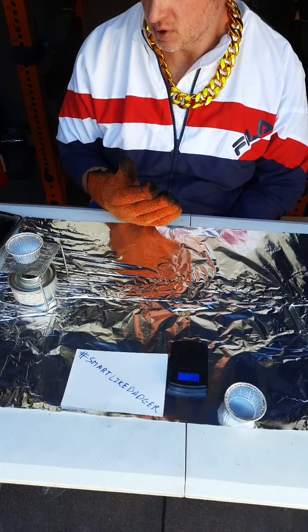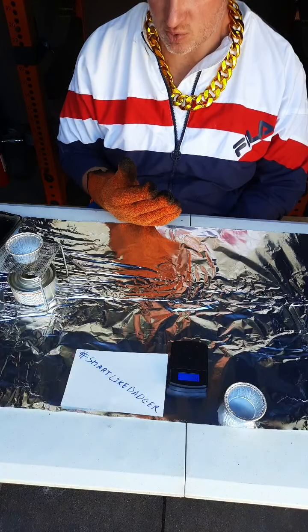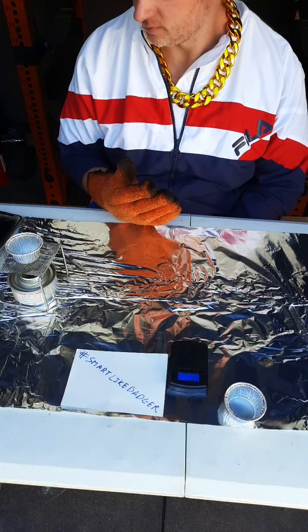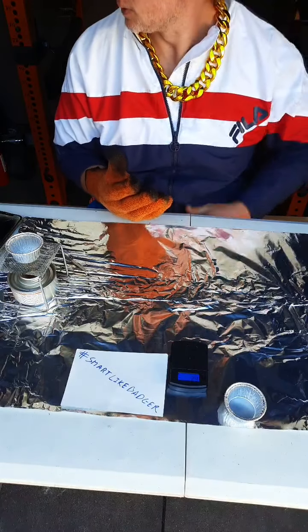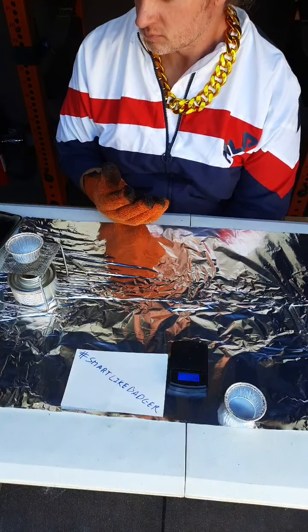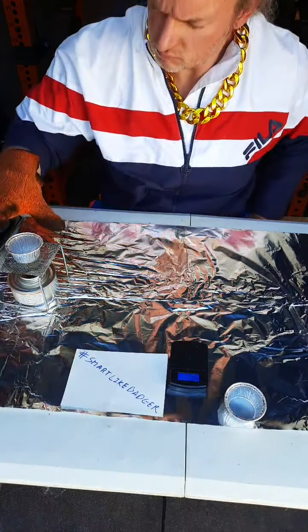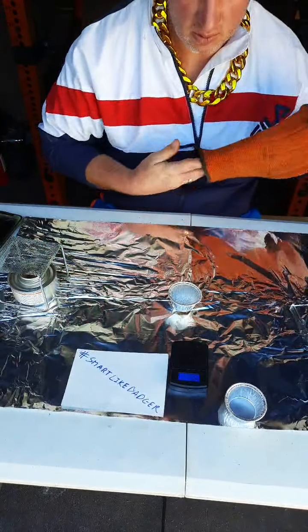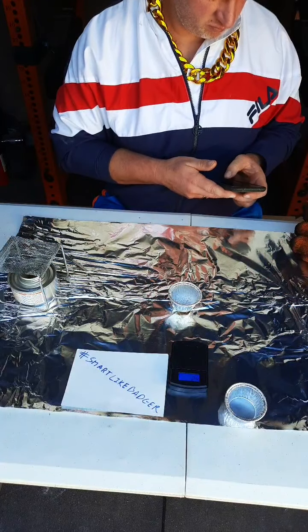We are doing our second heating right now. We will weigh this a second time, and if it still weighs 1.1 grams, then we will do our calculations. Roll this down here to cool for a moment.